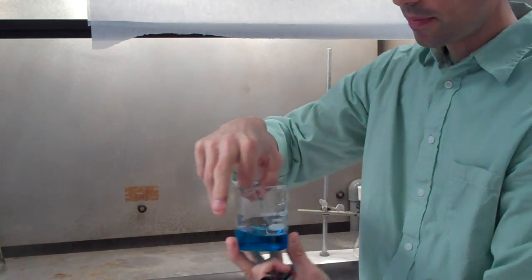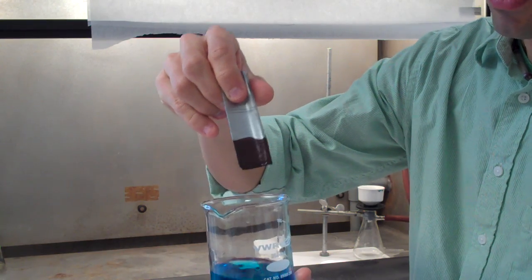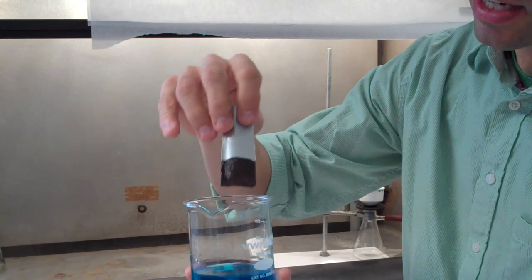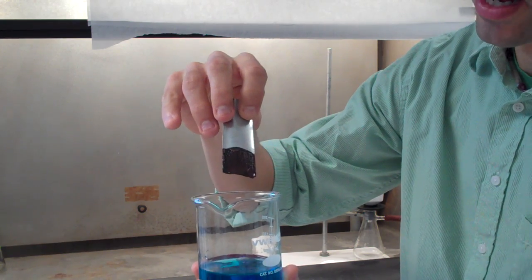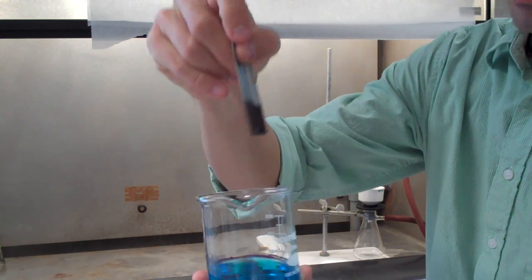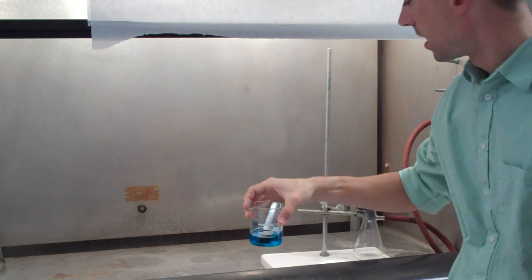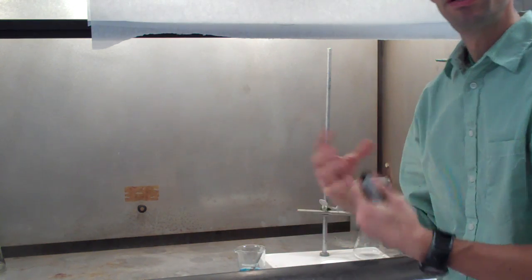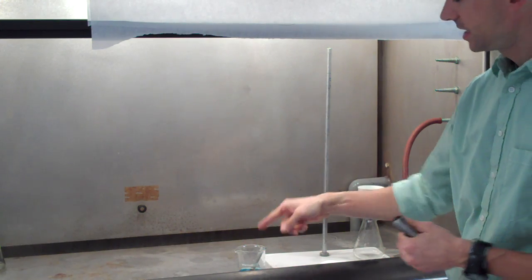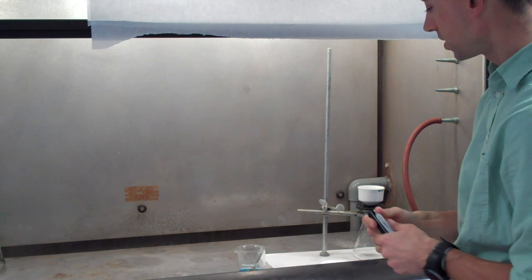And if I come up in front of the camera now, you should be able to see that we're starting to form copper on the outside of the piece of zinc. So in this case, we're really just coating the copper onto that zinc, and I could literally wipe that copper off right there. So we're going to use a very fine zinc powder to maximize the amount of copper that we recover. Technically, this has a thin strip of zinc still on the inside of that copper coating.